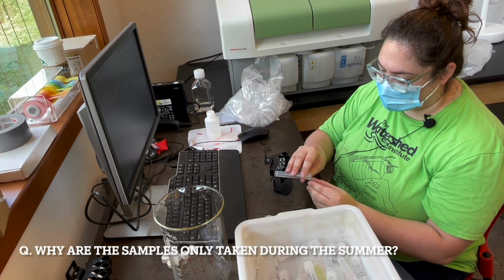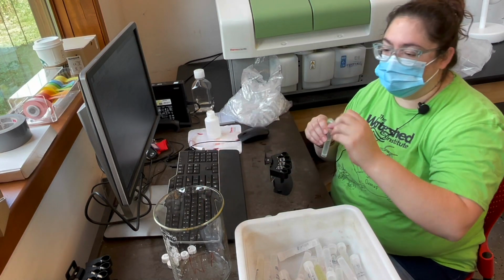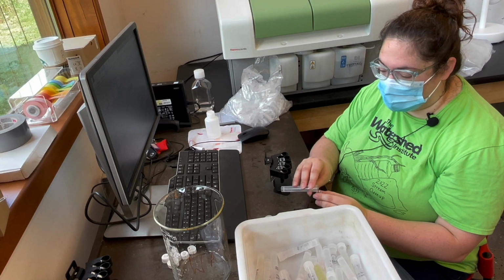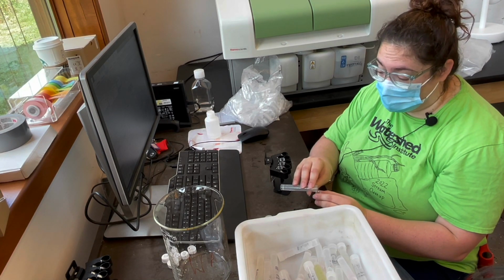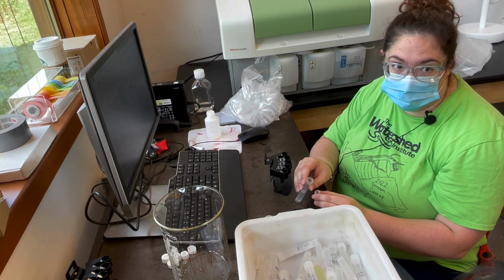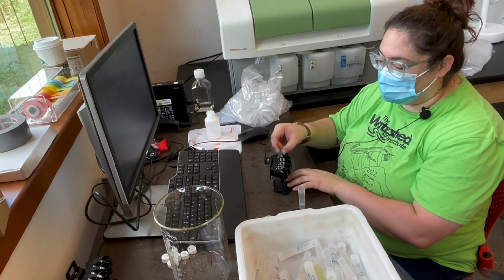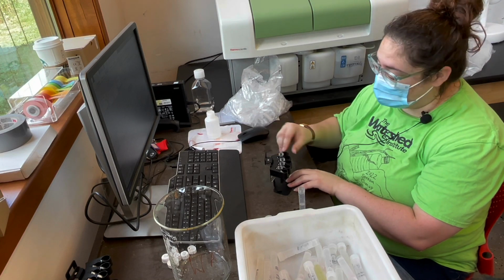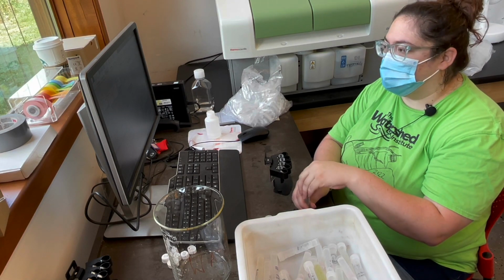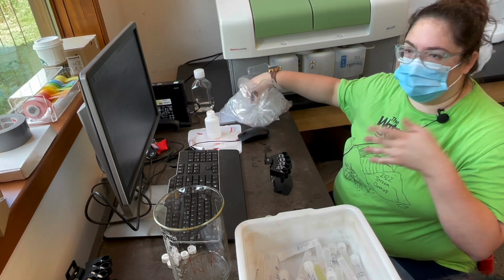Why do you only do this during the summer? So this program started by just looking for E. coli. And the reason we look for E. coli is because it can impact human health as well as pet health. So we only do that in the summer because that's really the only time that people are in the water. We do nutrient testing throughout the year, but we do a different kind of nutrient testing where our volunteers go out and they have a chemical kit that they do the test with themselves. So this, just because we have the samples of water, we started doing it with the machine.